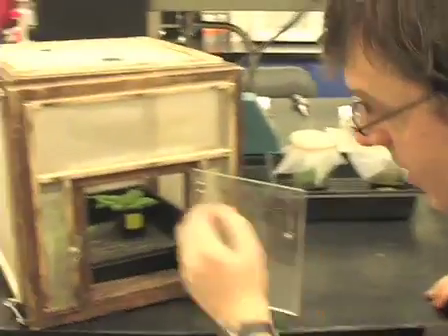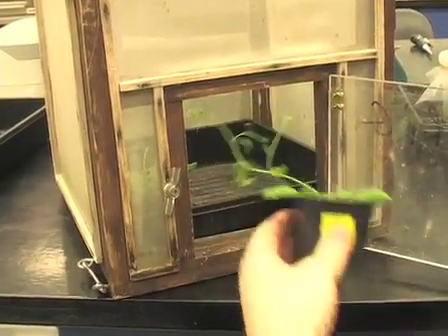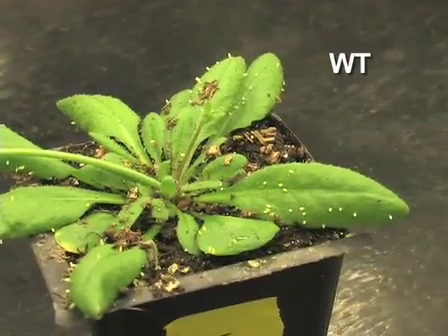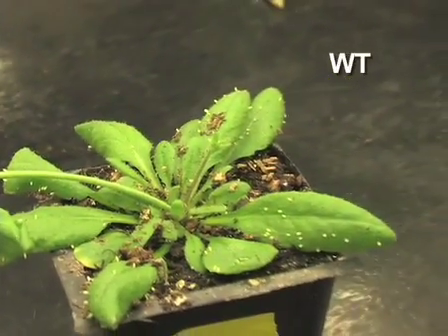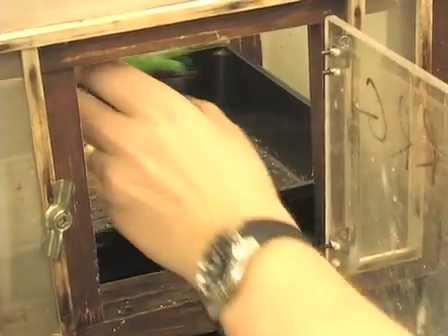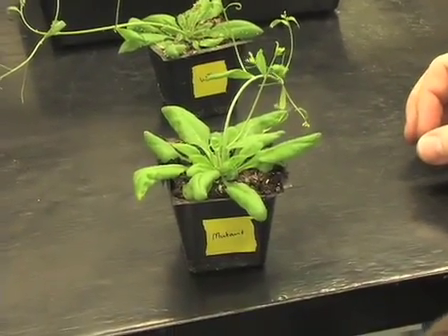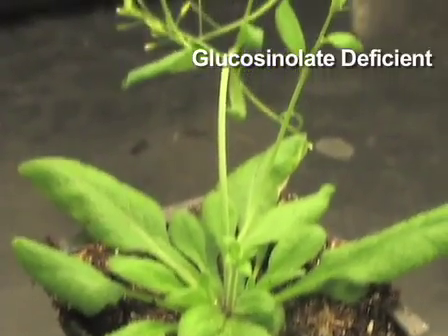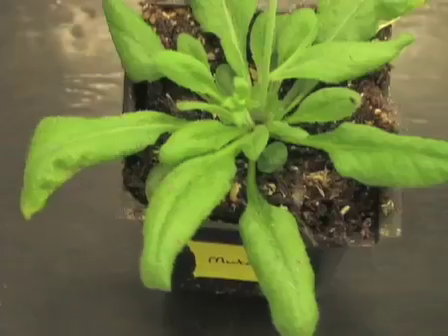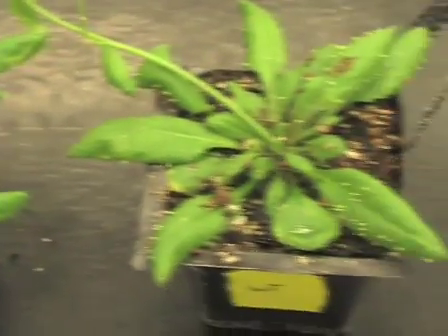After 24 hours have passed, we take out the plants. First, the wild type plant — as you can see, it has a lot of eggs on it. And the mutant plant, which lacks glucosinolates, lacks an oviposition stimulus. As you can see, there are hardly any eggs, or very few at least, on the mutant, while there are a lot of eggs on the wild type plant.